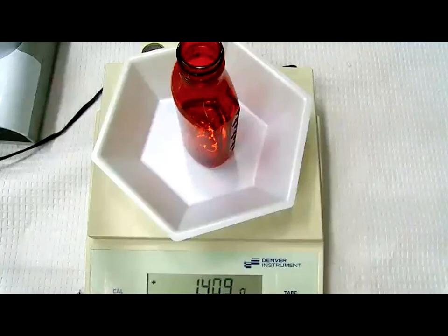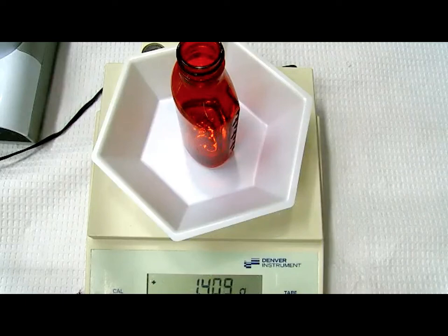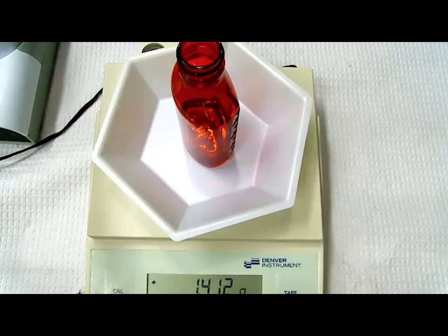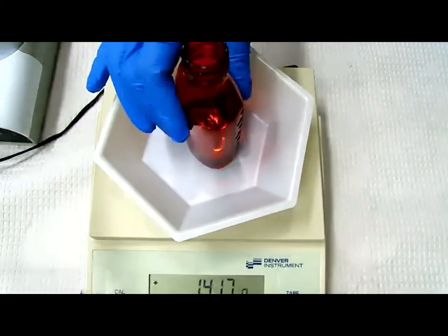So one quick thing before Dr. Wu finishes up on the procedure: there is a way to measure a liquid by weight without having to do it in the bottle. What you could have done is use a syringe, tare an empty syringe, pull up the liquid into the syringe and keep weighing the syringe until it's the right weight. That way she could always remove any extra until she gets the right weight and then squish that into the bottle. So you don't have to measure it into the bottle directly to avoid that potential concern, but this is definitely a quicker, easier way if you're careful.